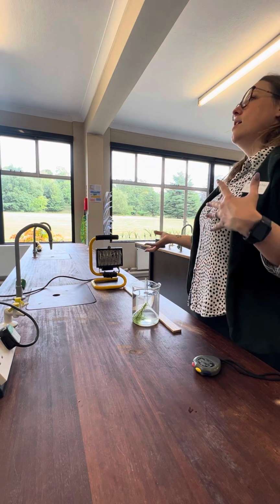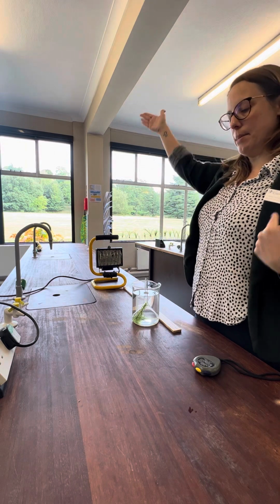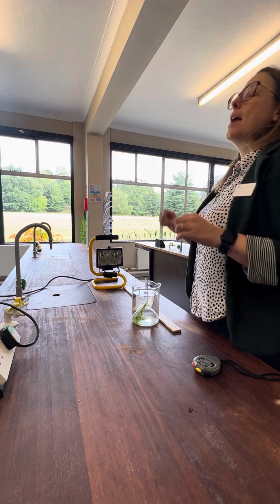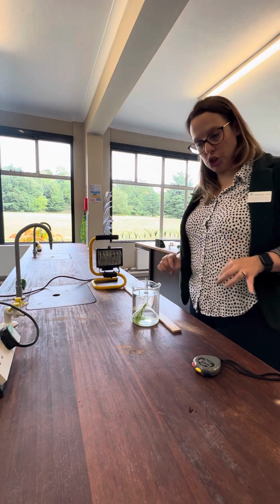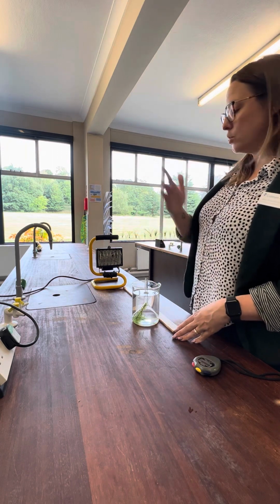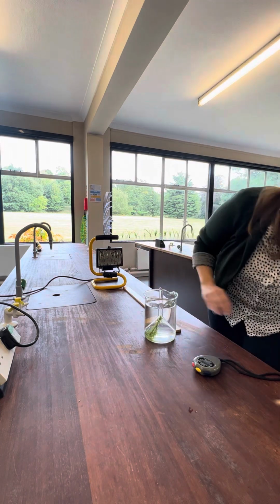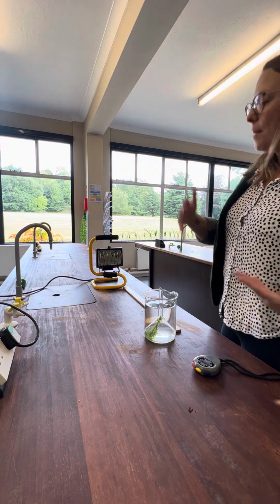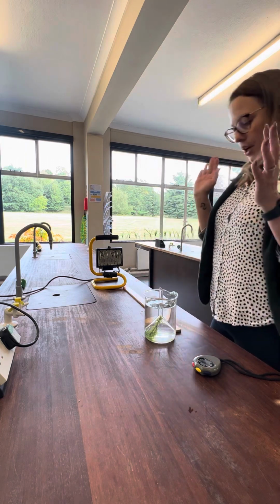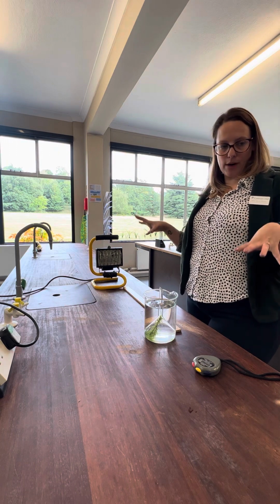The converse to that is a proportional relationship, where it increases by the same amount every time, or doubles every single time. That is a mathematical relationship that they might ask you about in your exam question, so you need to be aware that that happens. Because my light intensity halves every single time I move it away, when I'm up here, I'm probably not even going to see any bubbles in a minute, because I'm getting very little light. So that is your investigating photosynthesis practical, okay?